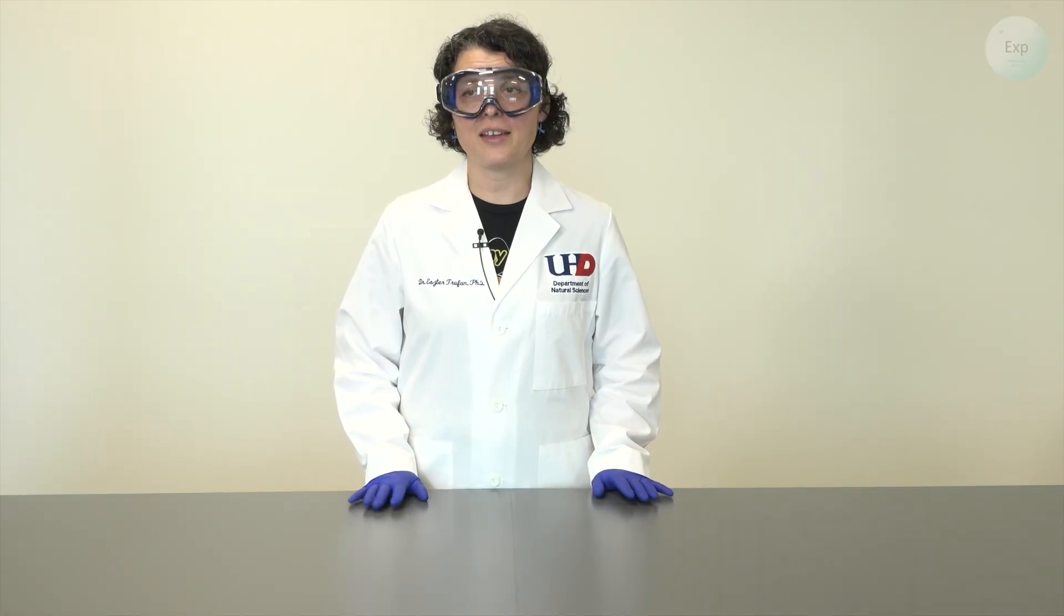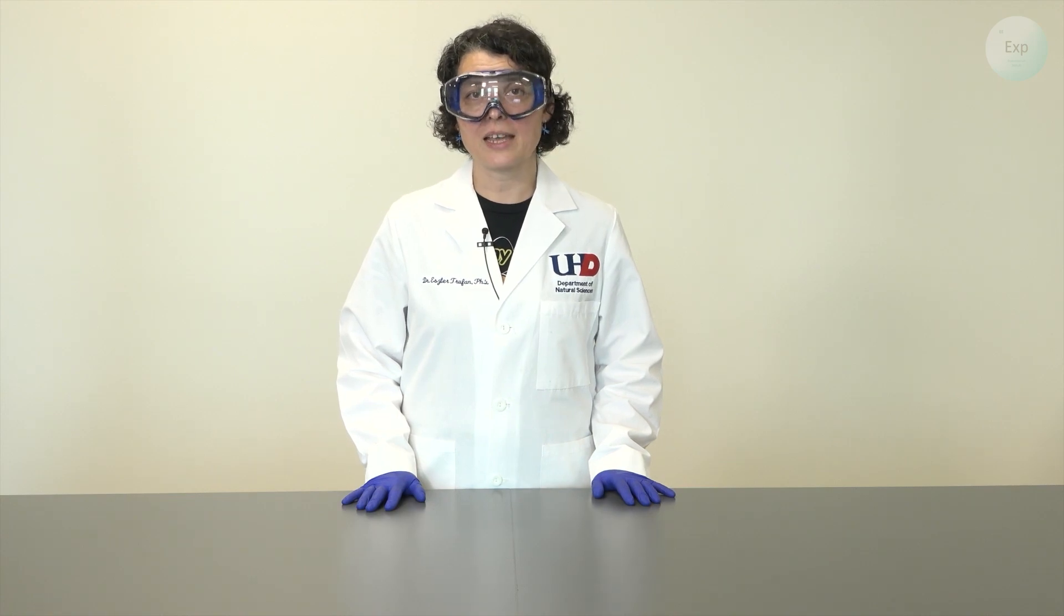Hello, my name is Dr. Esther Trufan and in this video I am going to demonstrate a method that will allow us to calculate the density of irregular objects.